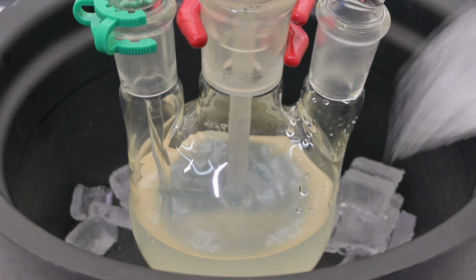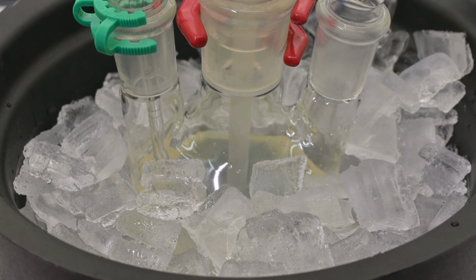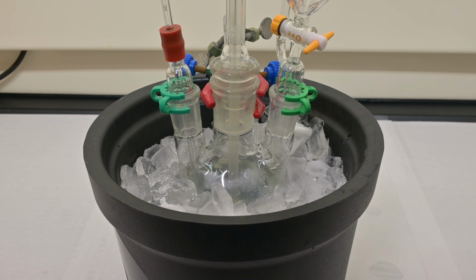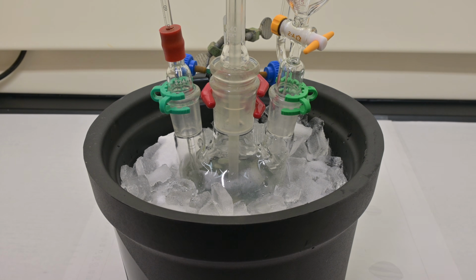After which, we place the flask into an ice salt bath to cool the mixture down to about 0 degrees Celsius. The bath is pretty effective, even capable of reaching temperatures below zero. We keep the solution stirred gently as it cools. This low temperature is super important because during the reaction it lets sodium nitrite generate nitrous acid, while keeping reactive intermediates under control.